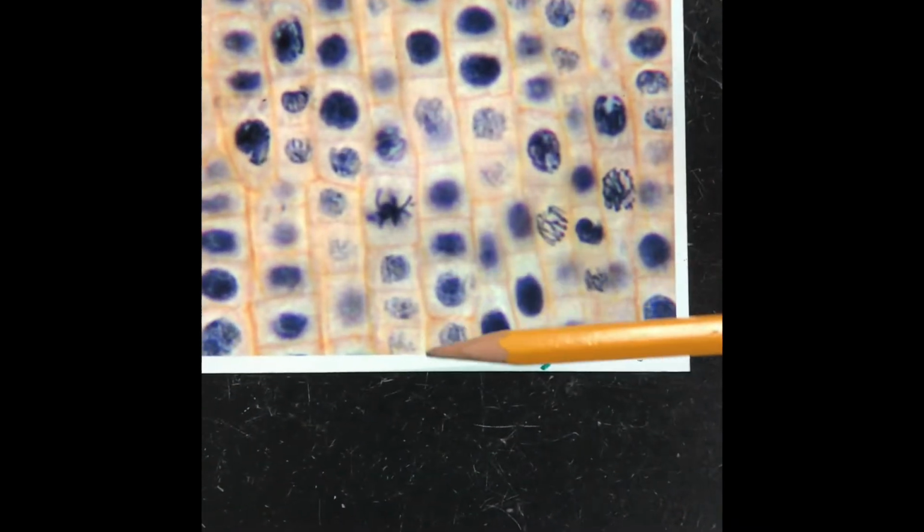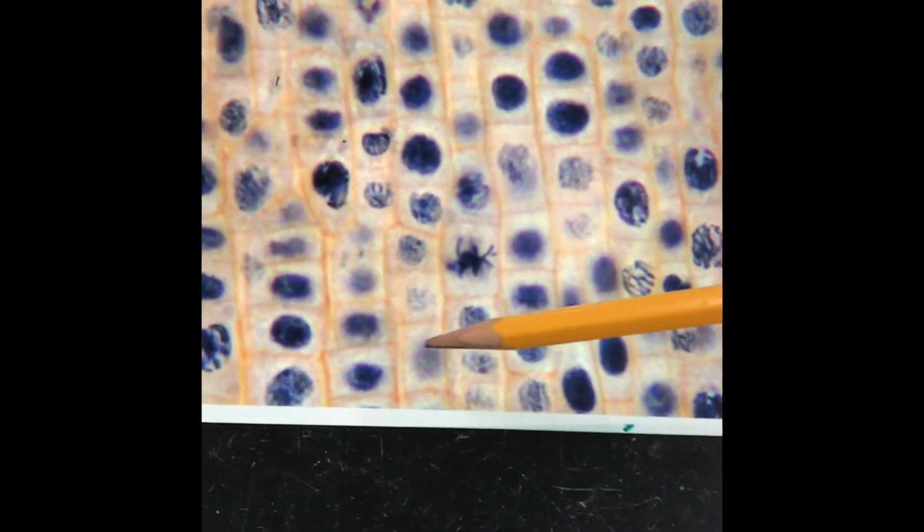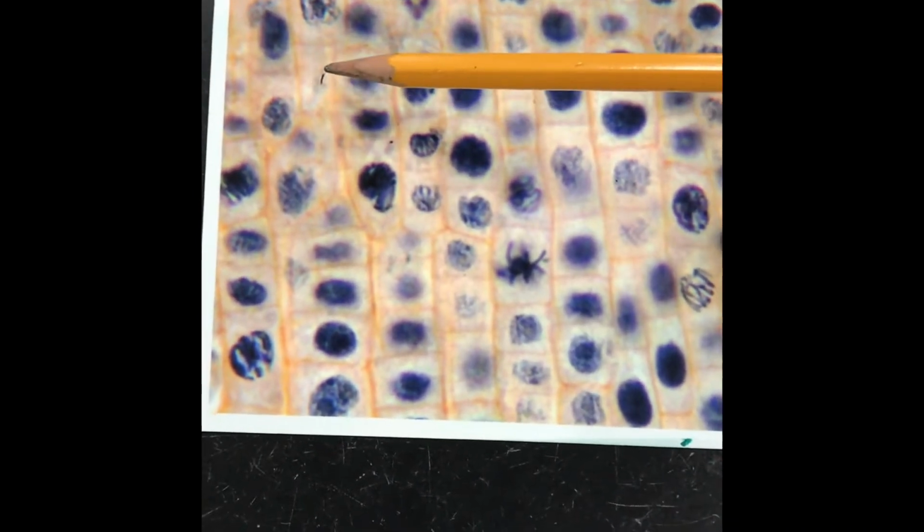Now, when you get to something like, let me see, this one doesn't have any dead cells. A lot of times you'll see dead cells. Well, this one right here. See this one?